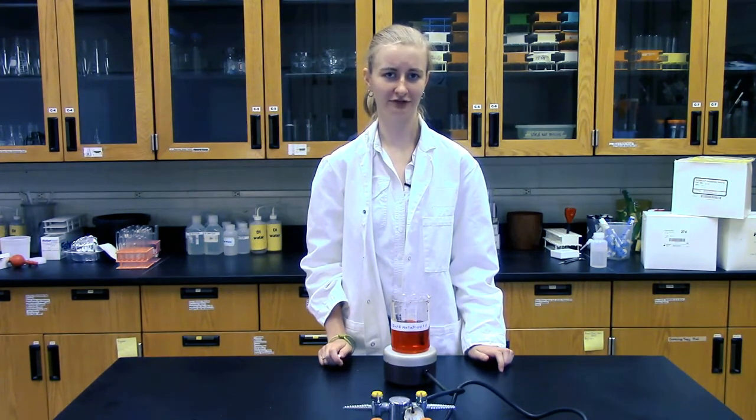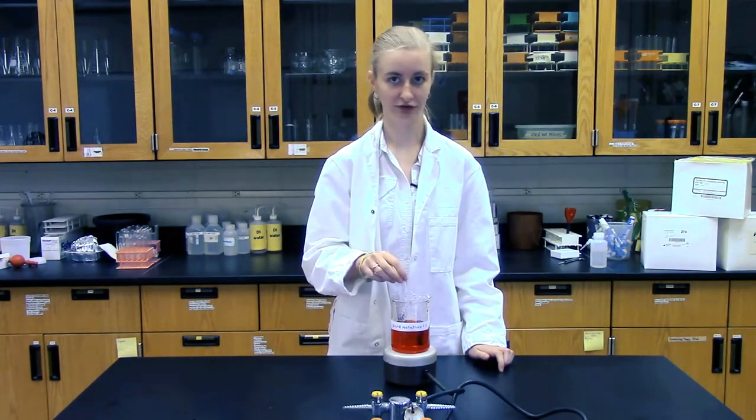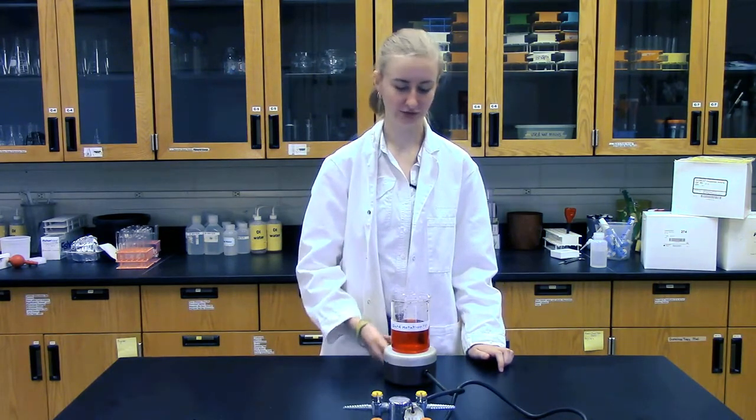Be careful if you are using a dangerous liquid, like a strong acid, because if you turn the stir bar on too high, it can splash. And we don't want that to happen, especially if it's dangerous.